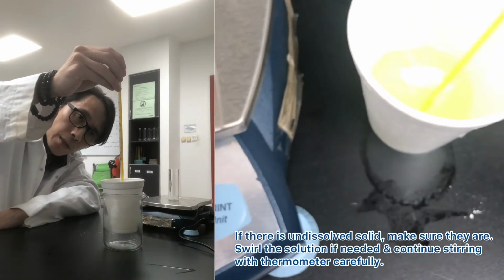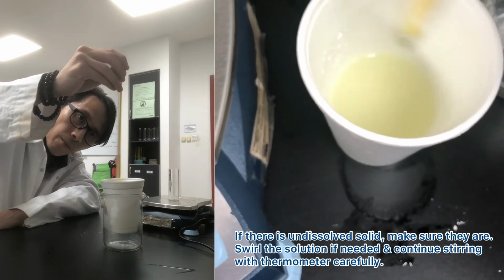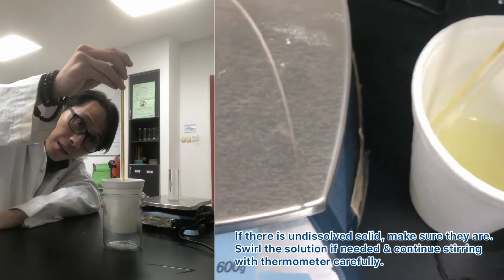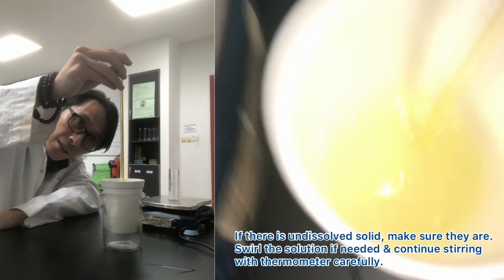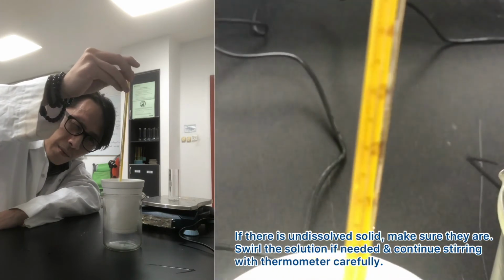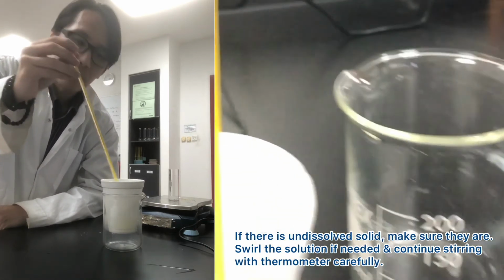Temperature went up to 31, 32, 33, still rising. Oops, looks like it stopped there. 34, let's do some solid dissolving. Barely 35. Is it going up anymore? Nope, that's it. So 35 degrees Celsius from 25. There's a 10 degrees Celsius difference there.